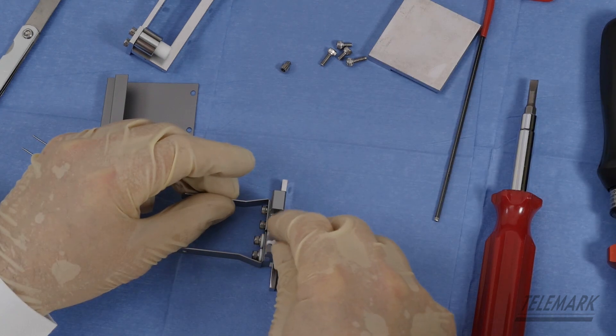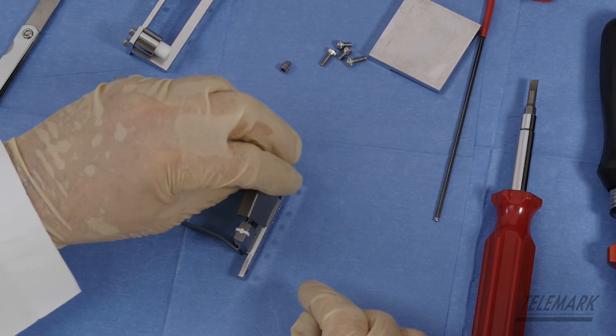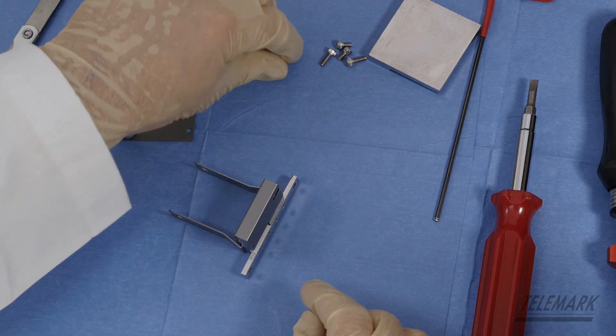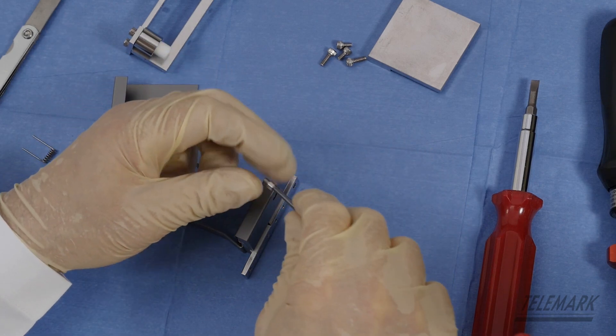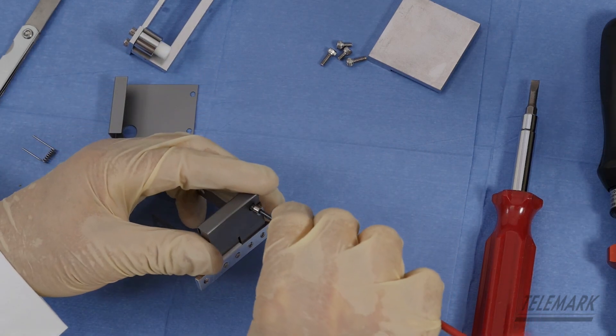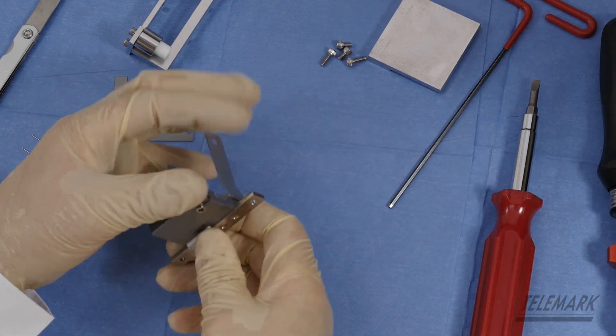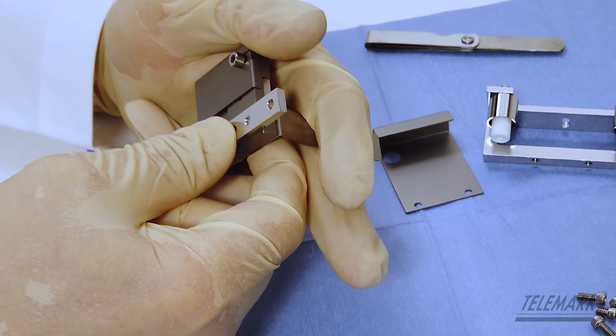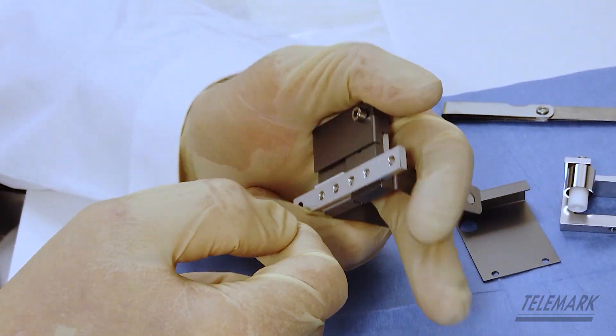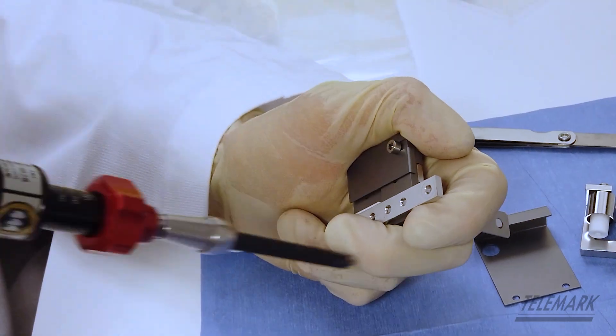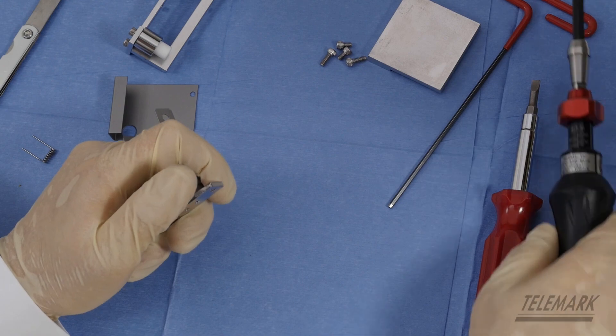You put an insulator cross in this little place and a beam former. You should have another titanium screw, 3/16ths in length. Put it in the back here. Beam former. Put my thumb on it so I push pressure inward and down to square it all up against itself. And then lock it down.